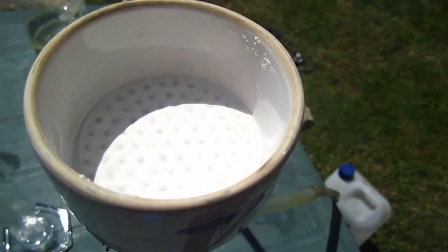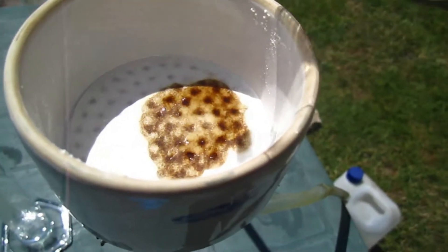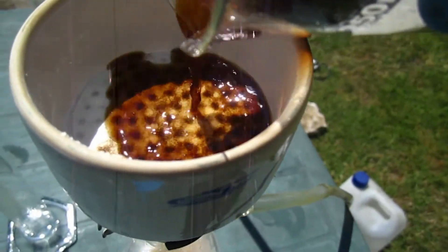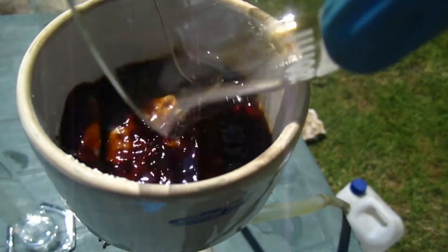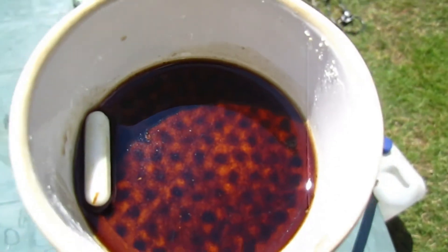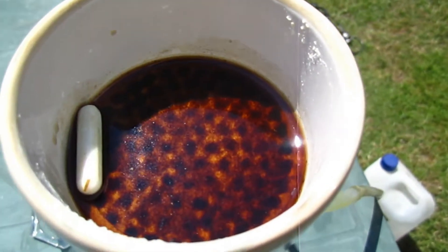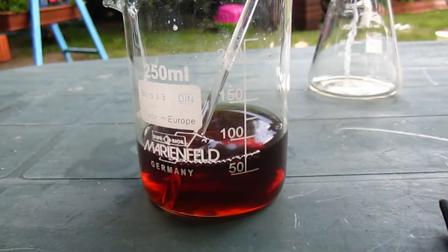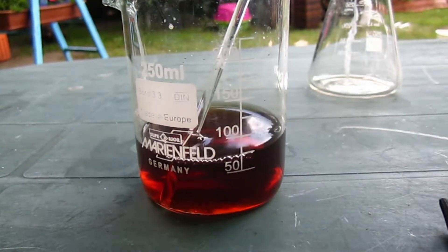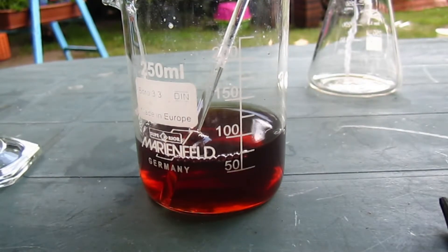So now I'm going to filter it out. So now after filtration, I'm going to acidify it with 20% sulfuric acid solution.